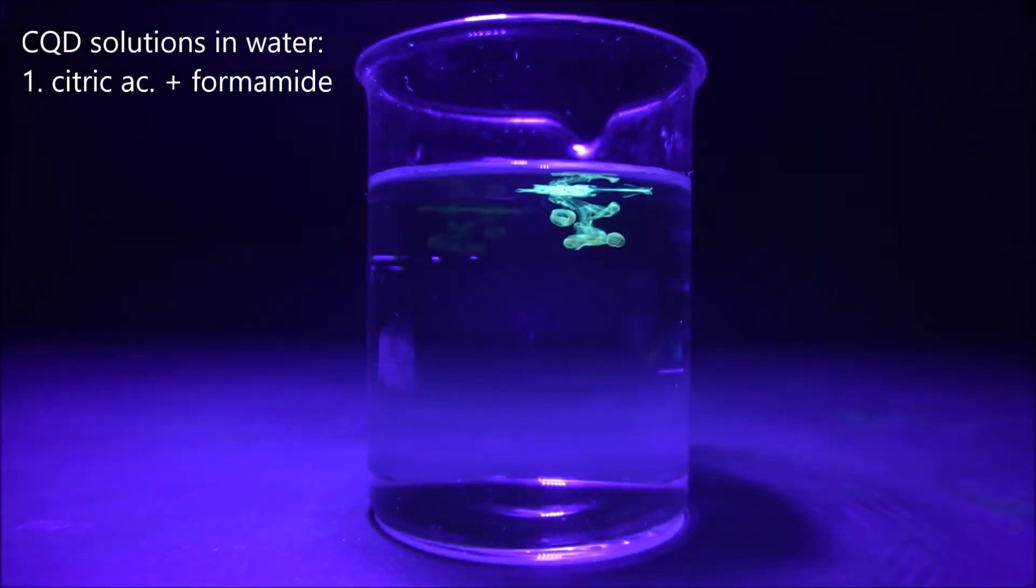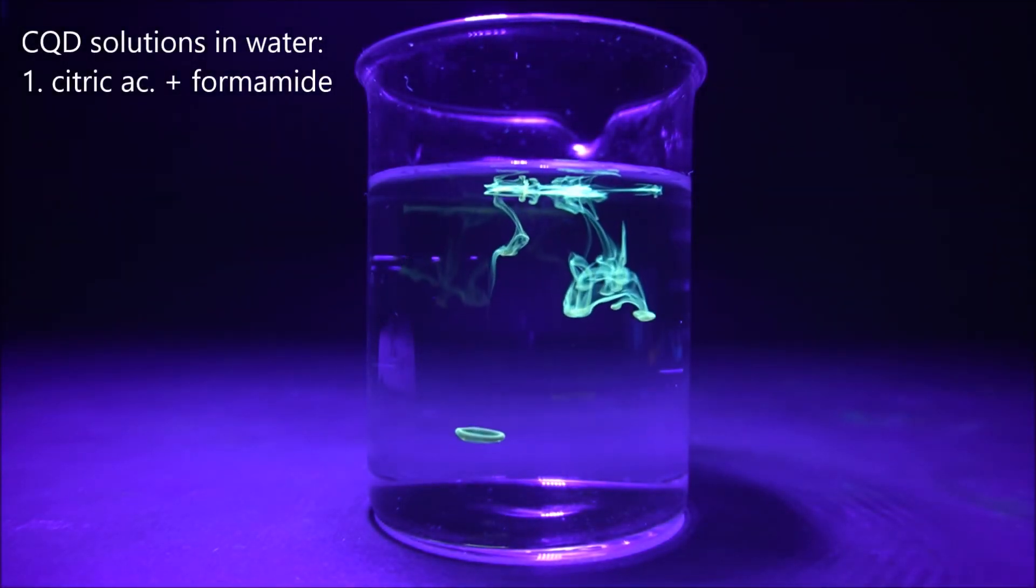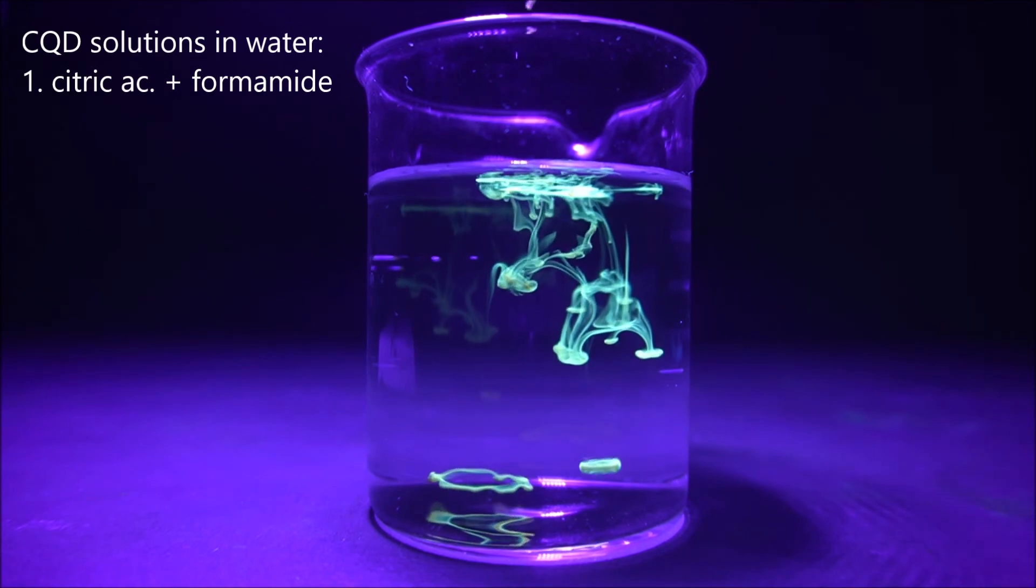And finally, here is how the two different types of carbon quantum dots look like when they are diluted in water.